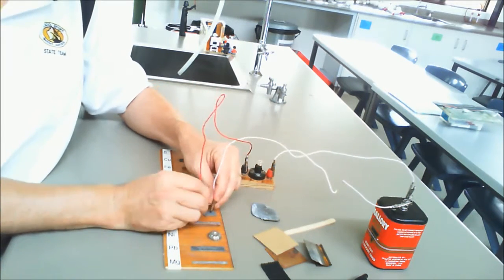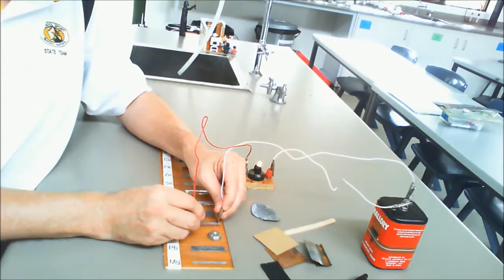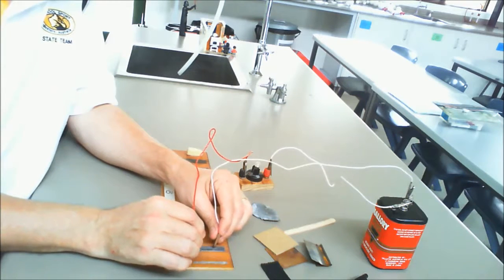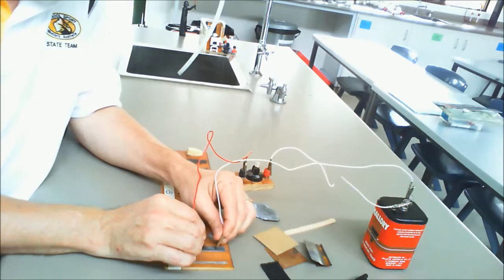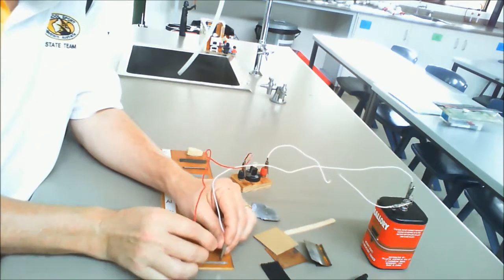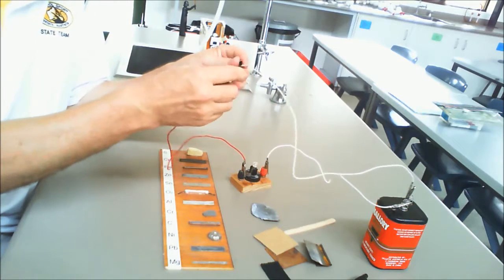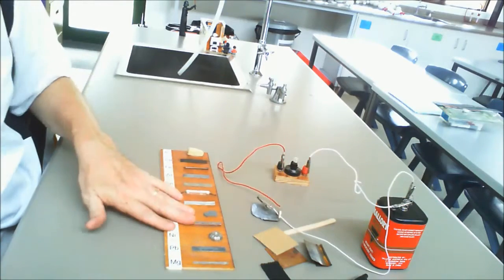Aluminium, which is a metal, conducts, as does chromium. Now, carbon is a non-metal, but carbon does conduct. Nickel there is a metal and conducts, and lead as well. Now this is just a little bit tricky, this one. And finally magnesium, which is a metal, also conducts. So we get each of the metals conducting, and the only non-metal that conducts is in fact carbon.